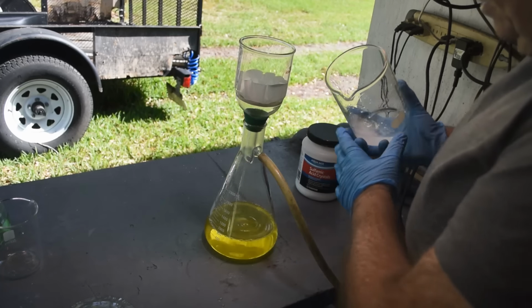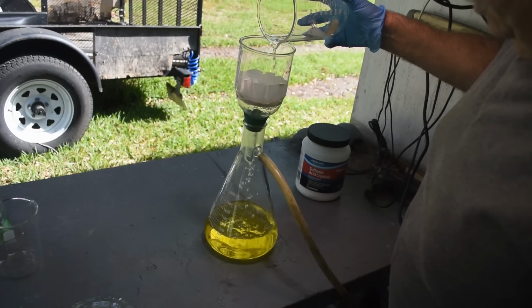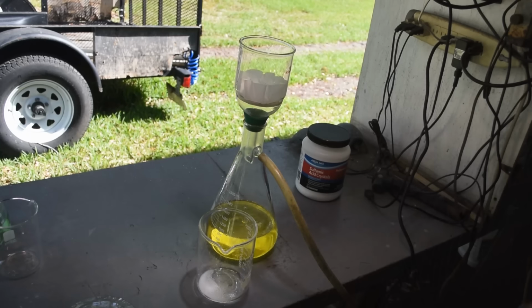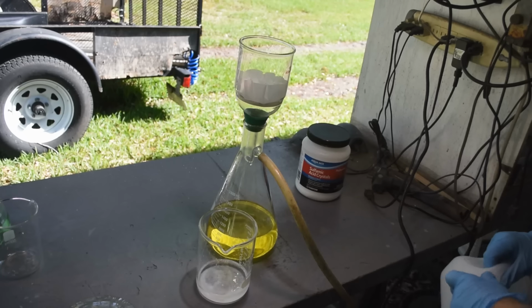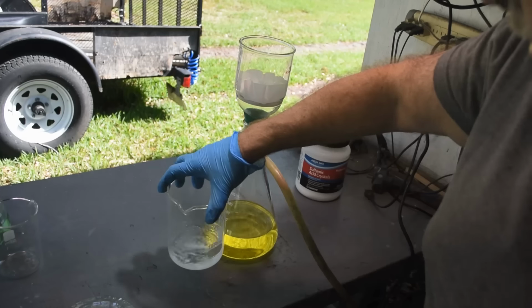So I'm going to make sure I get the rest of the liquid through, and there is some sulfamic acid left in the bottom of this beaker. I'm going to add a little bit more distilled water to it, see if I can get it to dissolve, and I'll run it through too, just to make sure we are thoroughly denoxed. Plus, this is also going to dilute the aqua regia a little bit, which is going to help the gold come out of solution. Gold likes to come out of a dilute solution rather than out of a concentrated solution.